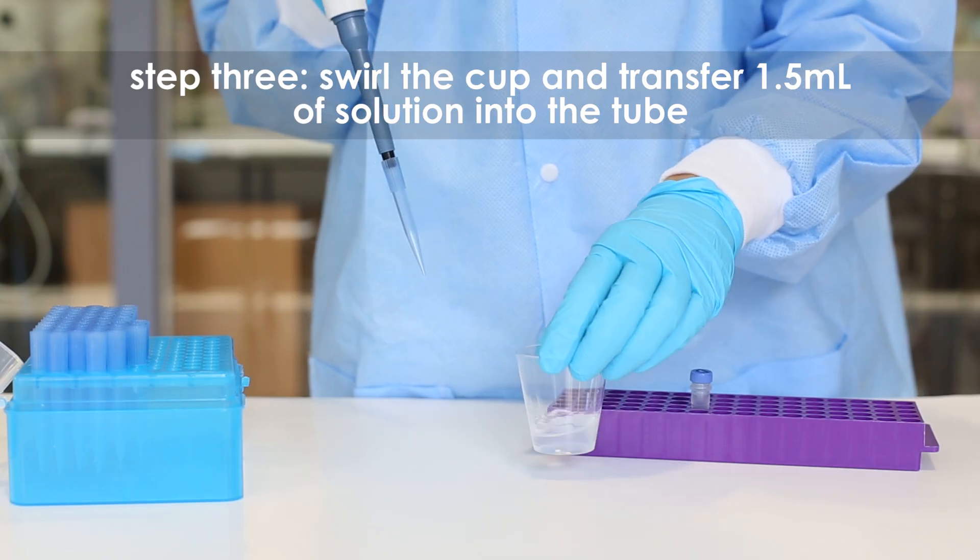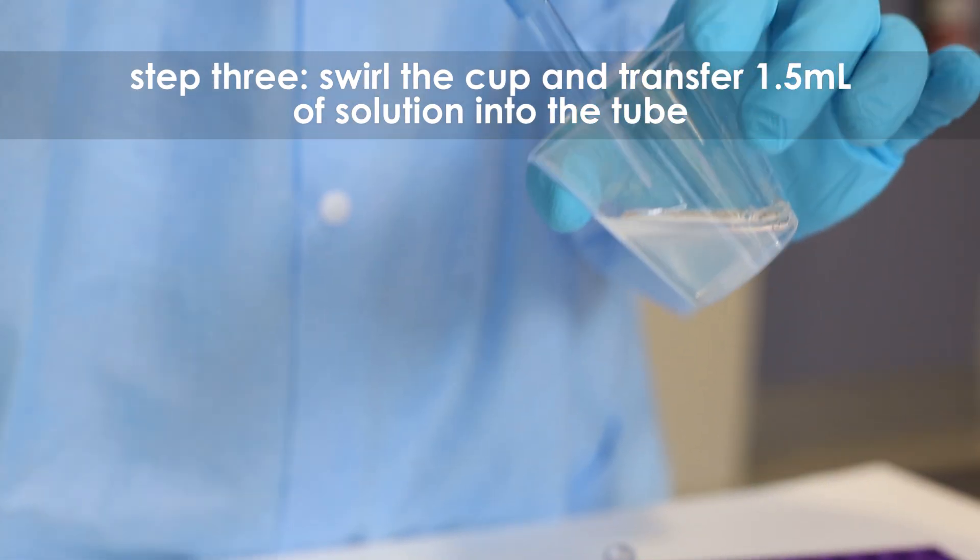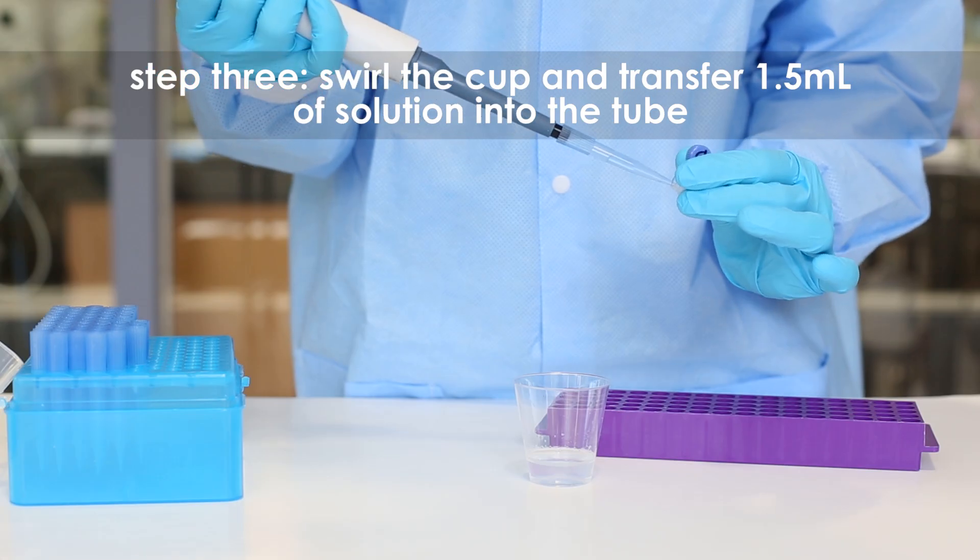Step 3: Swirl the cup gently to resuspend the cells. Transfer 1.5 ml of solution into the labeled tube.